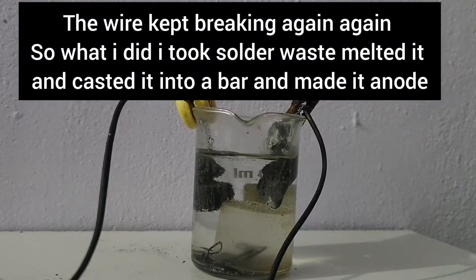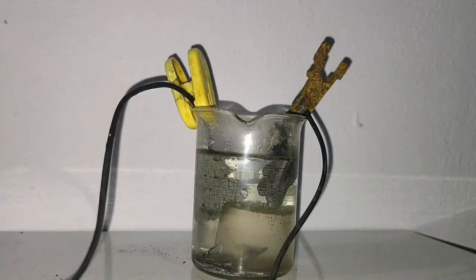The wire again and again broke. So I melted the waste solder and made it the anode.